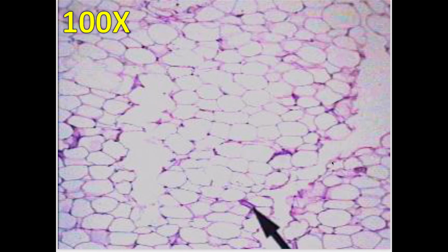Now, this is, again, kind of pixelated because the scope camera that I use, remember, has pretty low resolution. I will say, though, when you're looking at these in lab, they probably won't even look this good. I know it's kind of shocking to think that looks good, but you will see this honeycomb-like appearance, but it is going to look almost invisible. So my rule of thumb to students is always, if you sit down at a microscope and what you see looks to be invisible, that's because you're probably looking at body fat.